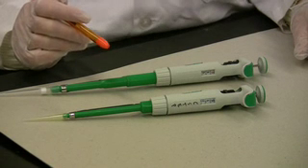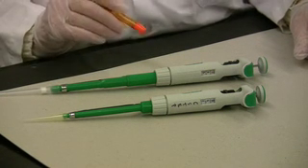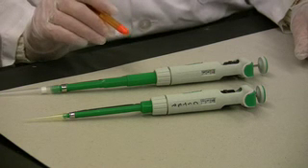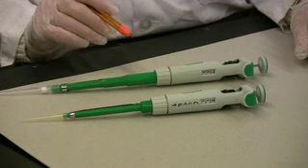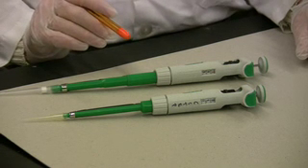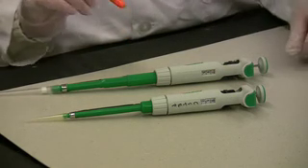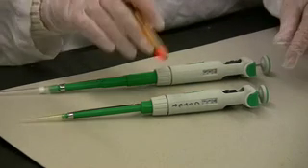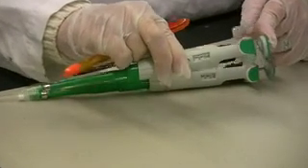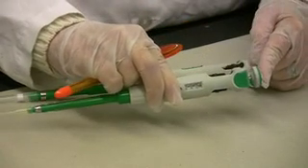No matter where you purchase your micropipetter, fundamentally they are structurally the same. The parts of a micropipetter include the plunger button, which is used to draw up and discharge your sample.